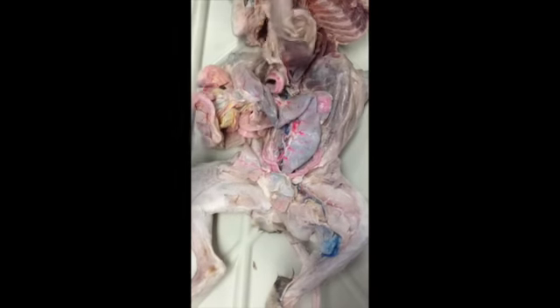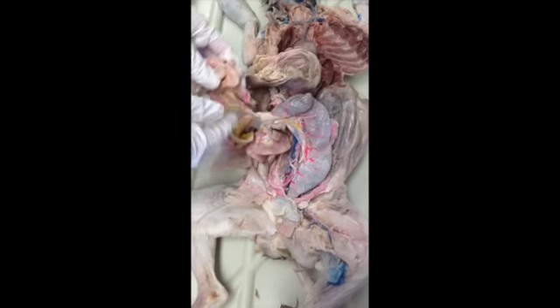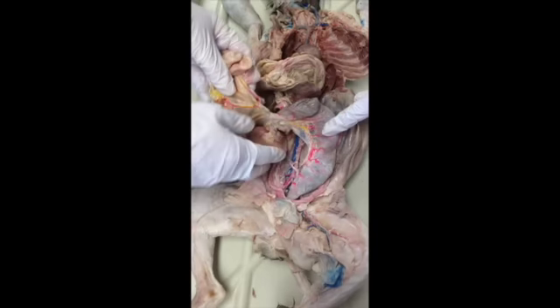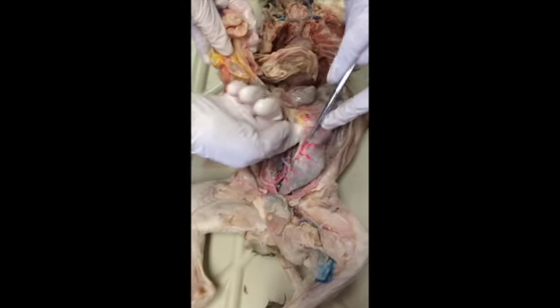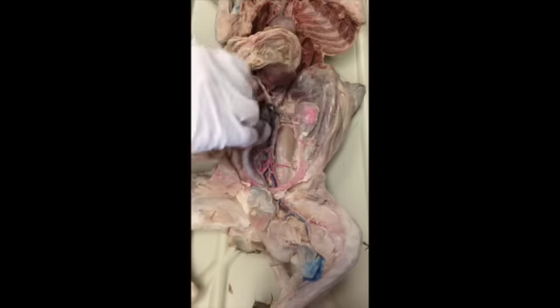Do we need to see anything else again? Was that the inferior mesentery or the superior? What is this? That's your intestines. So which one would it go to? It's the superior, yeah. And there's still some mesentery down here from the colon. Okay, inferior. There normally would be a lot in there.